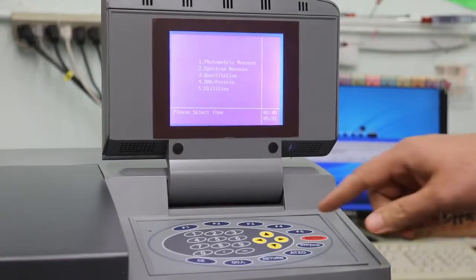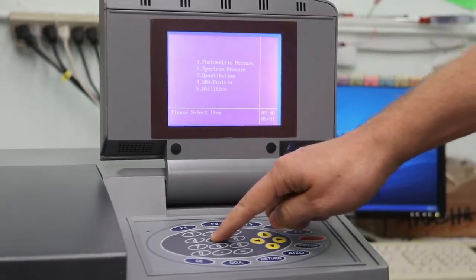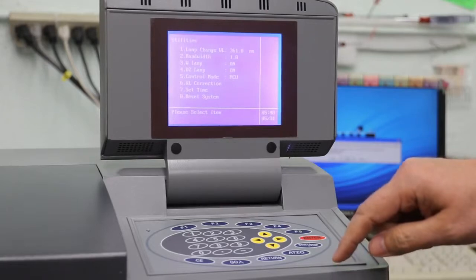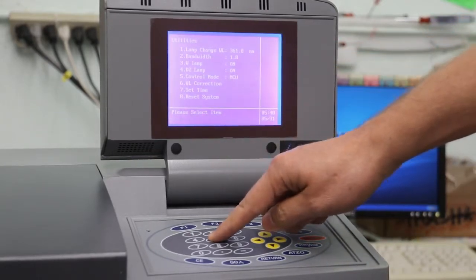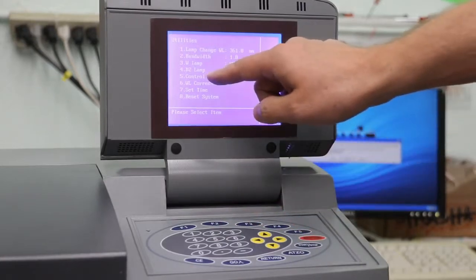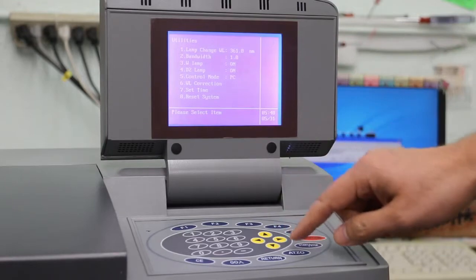On this machine, we're going to select number 5, Utilities. Then again, number 5 for control mode. Notice when I hit that it went to PC, and now we'll hit return.